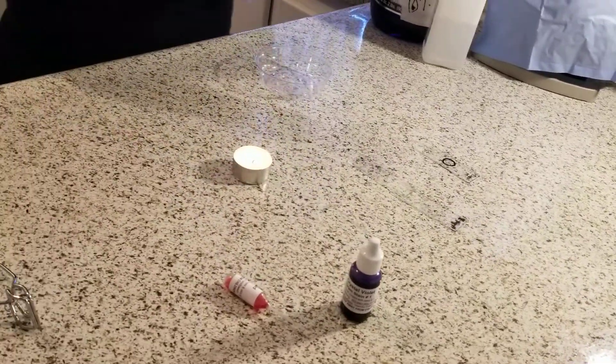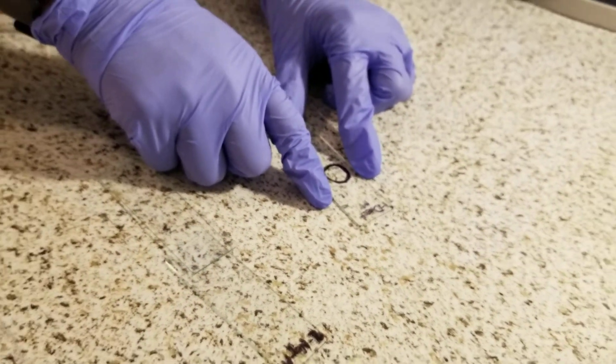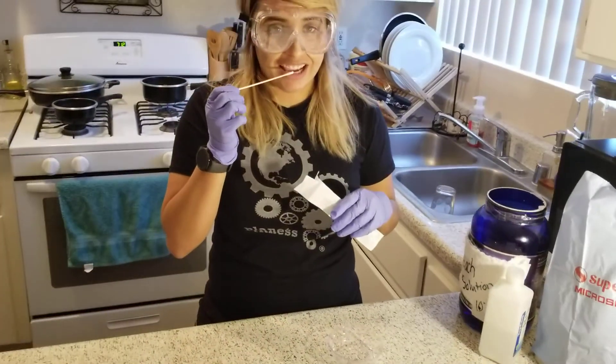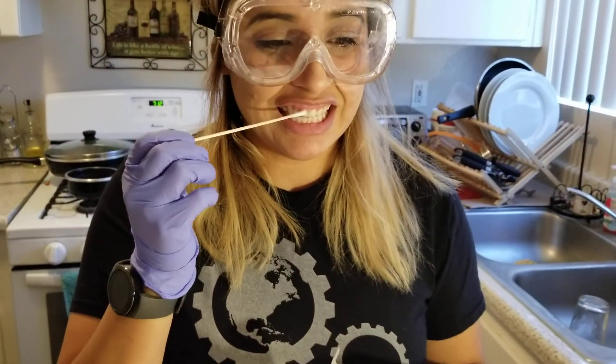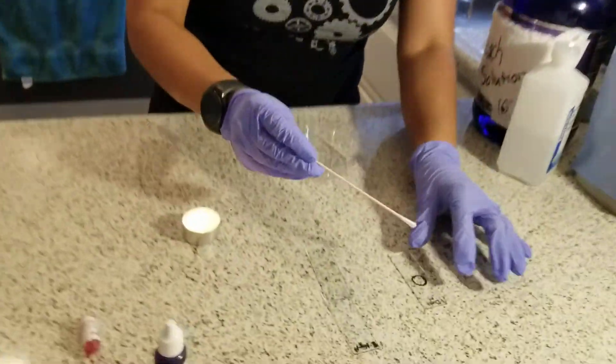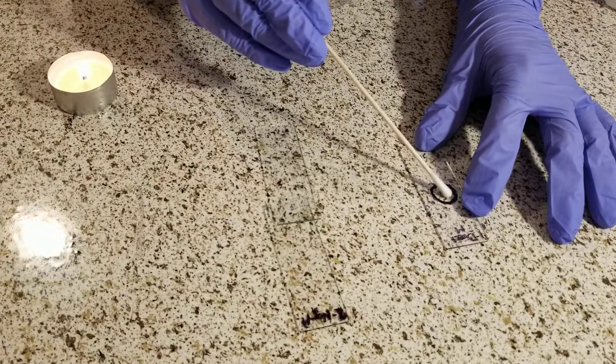On this first slide, the label '1' indicates the first slide, 'Direct' indicates the procedure will involve direct stains, and 'M' indicates that the sample will be from the mouth. I will collect my sterile swab and vigorously scrape the insides of my gums and teeth. Then with the swab I will use a circular motion within the circle on the slide. Then after that I will let it air dry.